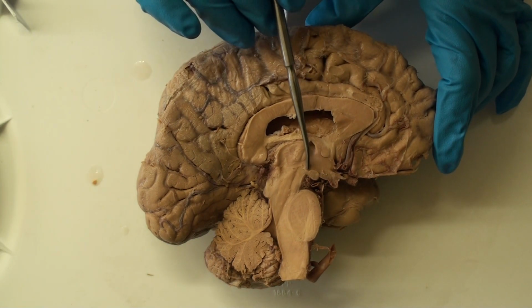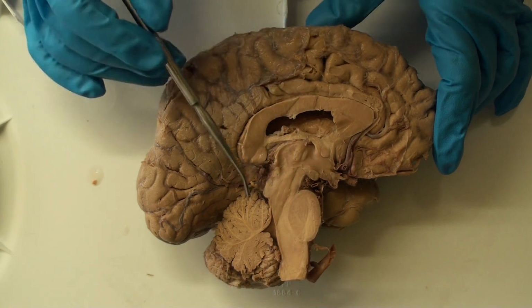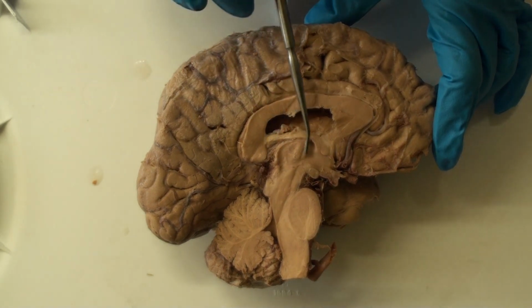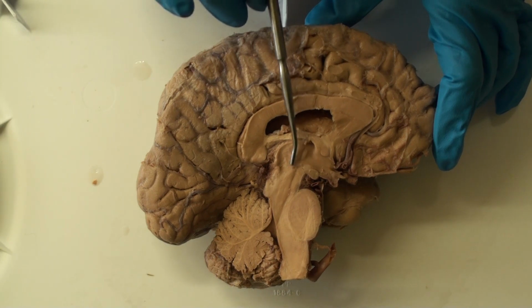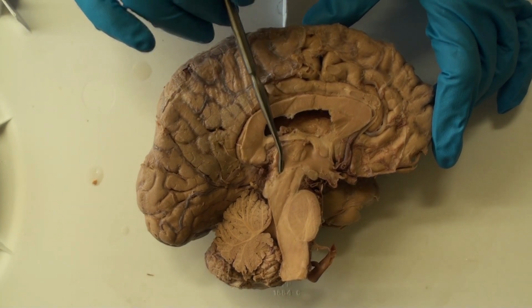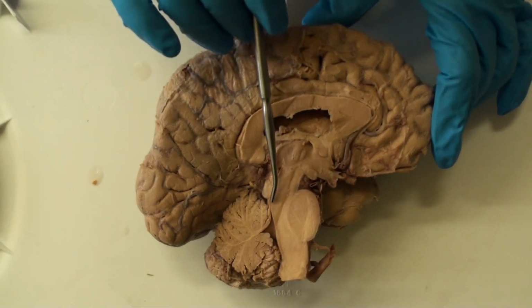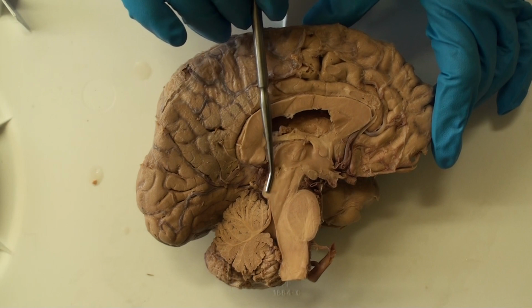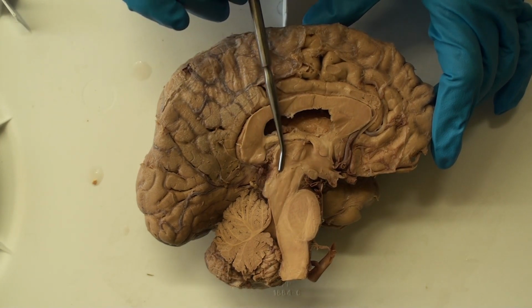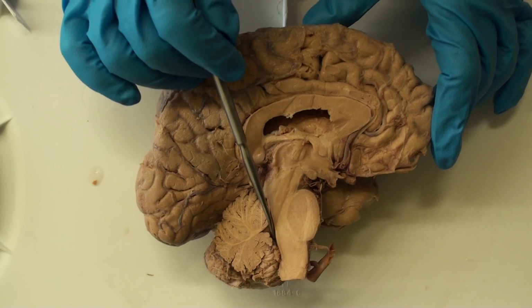At the inferior edge of the hypothalamus, and a little more posteriorly, we see the cut edge of a rounded structure called the mammillary body, and the mammillary body is part of the hypothalamus. And then posterior to that, we are now in the brain stem, and we cannot quite see the structure that joins the third ventricle to the fourth, and that structure is the cerebral aqueduct. But because this again was a little off midline, I can put my probe down in the cerebral aqueduct here. So this would be the midbrain right here. This is also part of the midbrain, and in between what's called the tegmentum of the midbrain and the tectum of the midbrain is a depression, a canal called the cerebral aqueduct, and cerebral spinal fluid flows from the third ventricle to the fourth ventricle through that cerebral aqueduct.